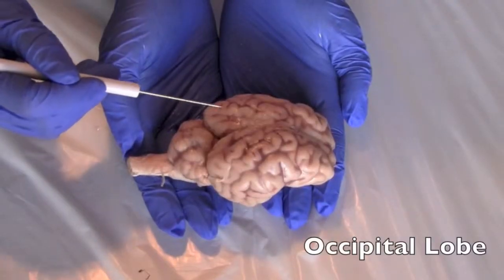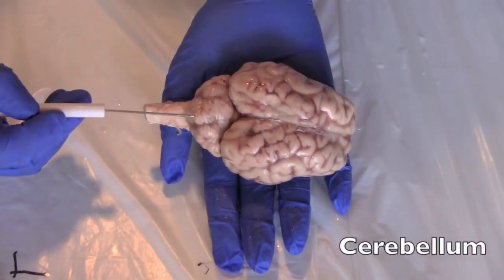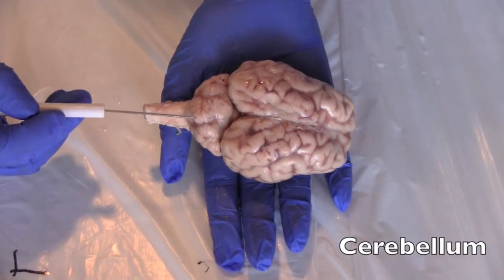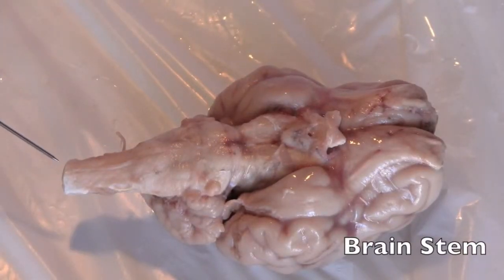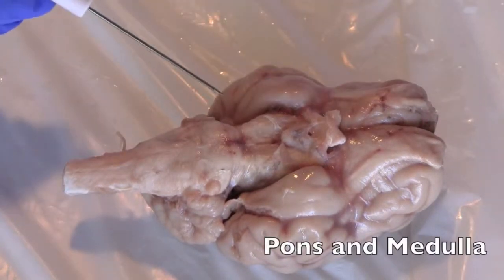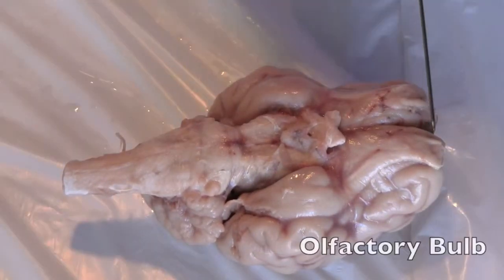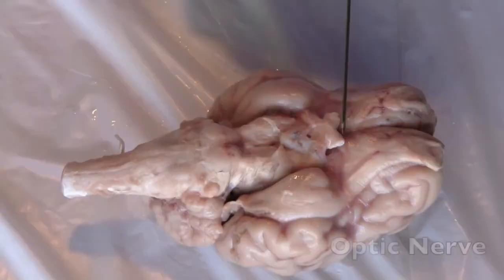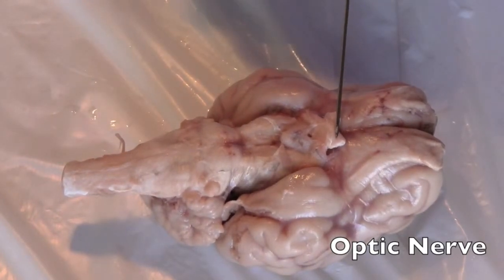This is the occipital lobe, and it processes vision. This is the cerebellum, and it helps with coordination and balance. From here to here is the brainstem. Within the brainstem is the pons and the medulla. Over here we have the olfactory bulb, which processes smell. Over here we have the optic nerve, which takes the image from the eyes into the occipital lobe.